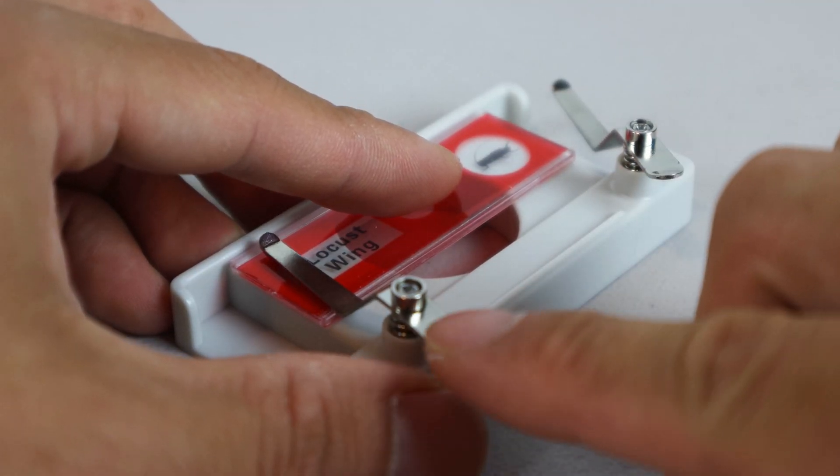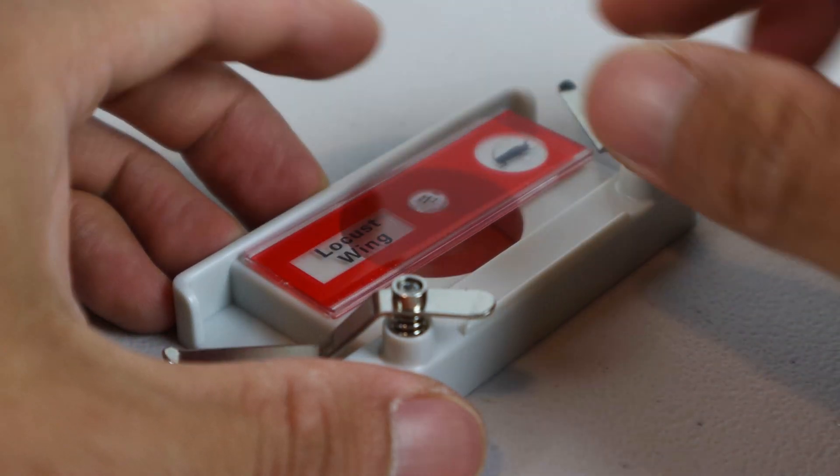To release the slides, just press down on the end of the clip and rotate it away from the slide.